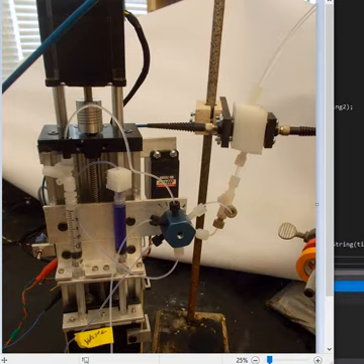I want to talk to you today, give you a little rundown on the project we're working on. It's a chemical kinetics project, and it uses the hardware that we made in our little laboratory shop. This shows a picture of an injection apparatus that has two syringes, one of which has a base solution and one of which has a crystal violet solution. When you mix these two together, you will get a reaction that bleaches out the spectrum of the crystal violet, and you can measure it spectrophotometrically.